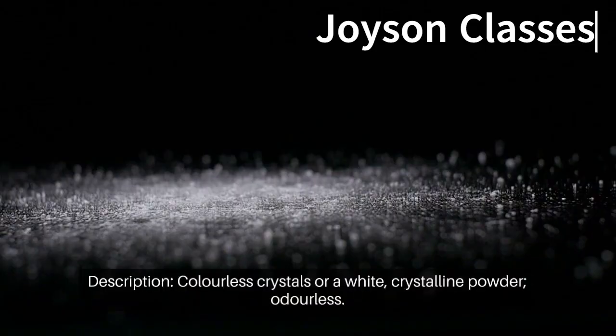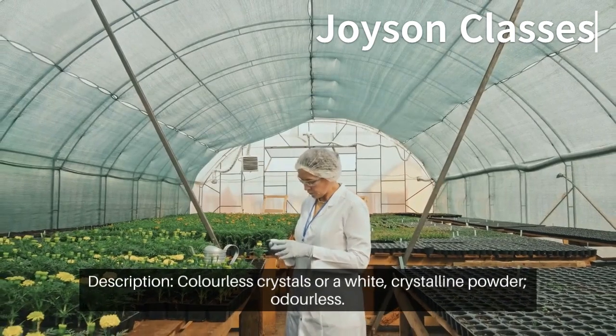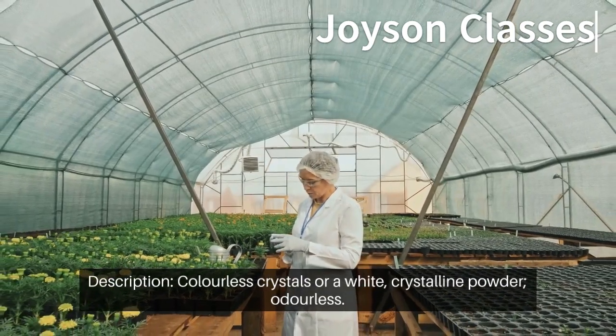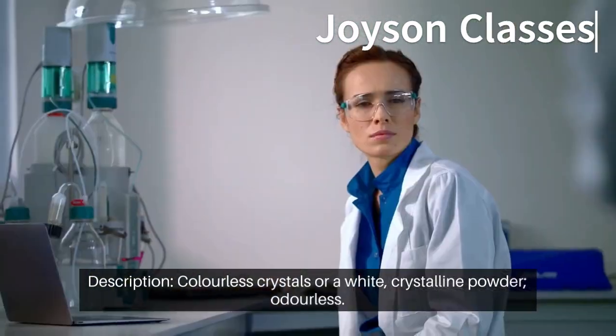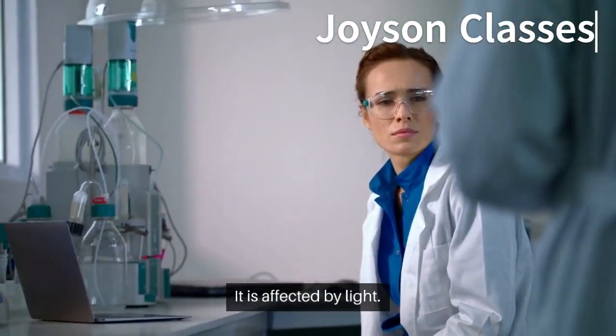Description: colorless crystals or a white crystalline powder, odorless. It is affected by light.